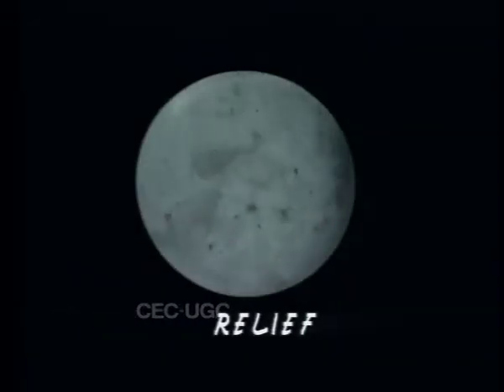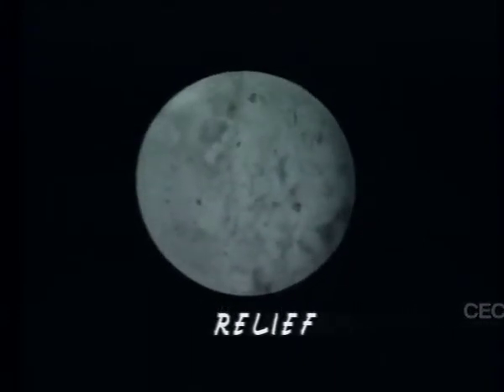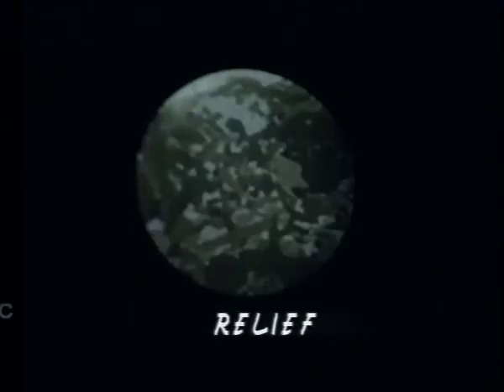When there is a greater contrast in refractive index, the grain boundary is distinct and the mineral is said to have a high relief. On the other extreme, when there is little or no contrast in refractive index of adjacent grains, the boundary is faintly visible and the relief is low. Quartz and feldspars have low relief compared to mica, garnet, amphibole, and pyroxenes.